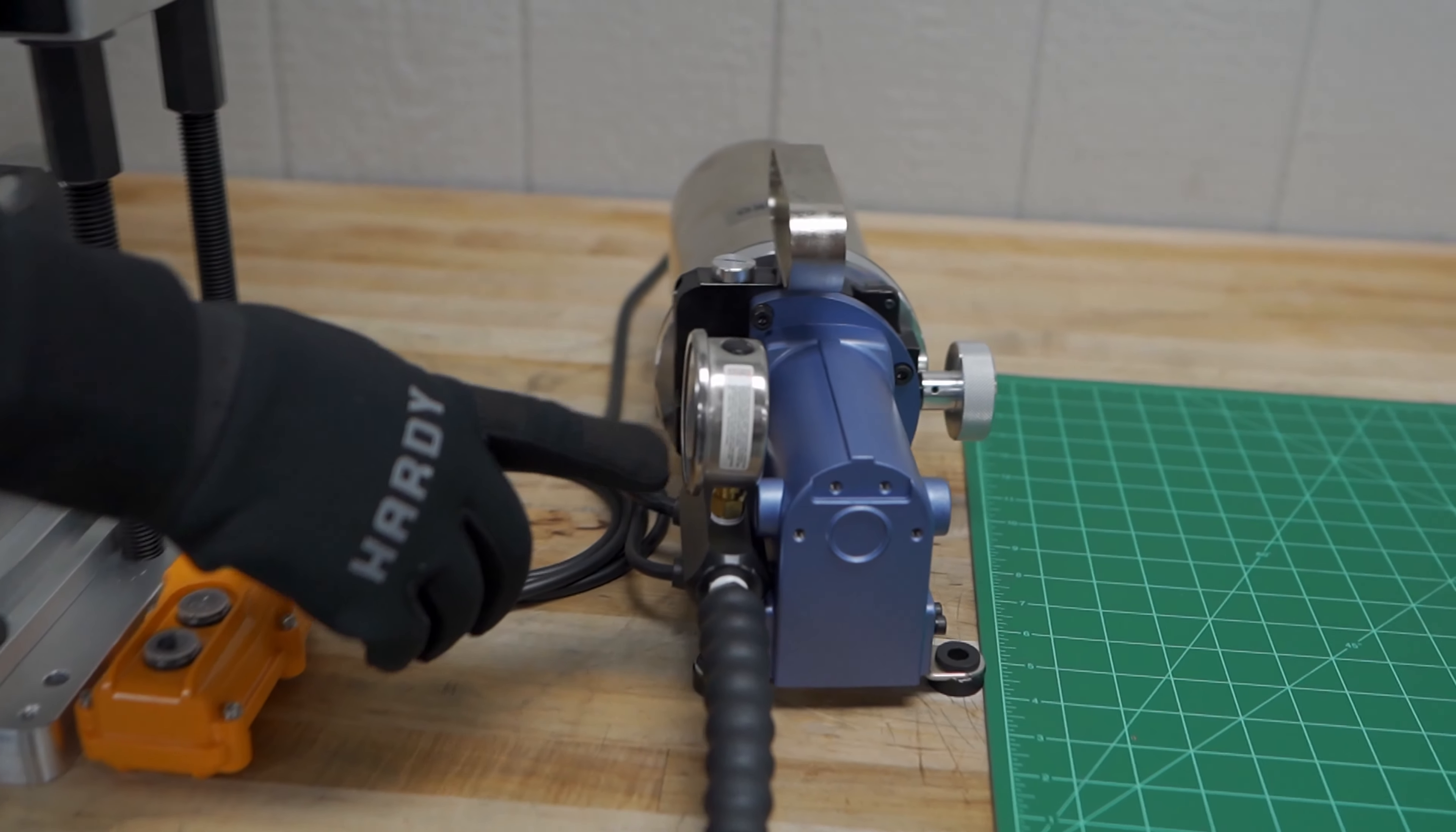We're now ready to inject. I see a little drool, so we're going to pull that drool off and discard that.